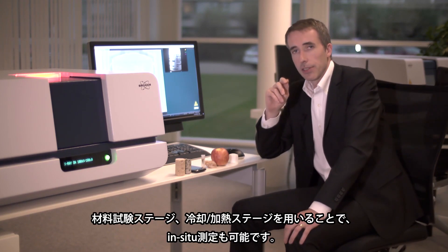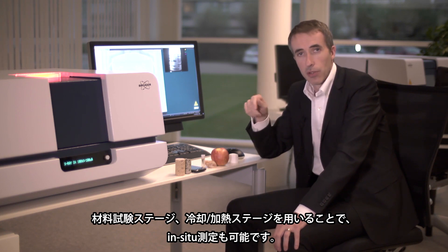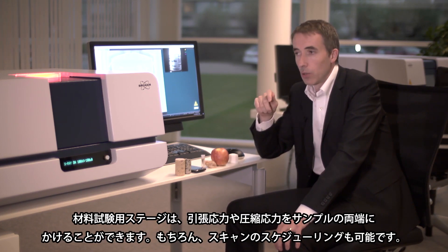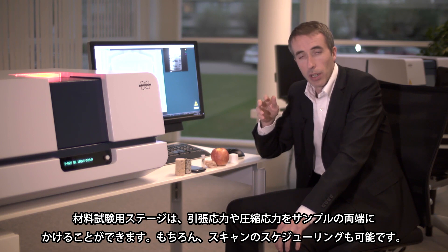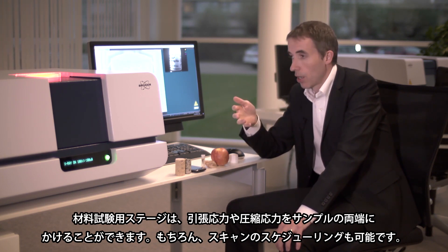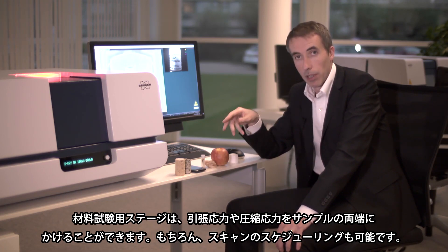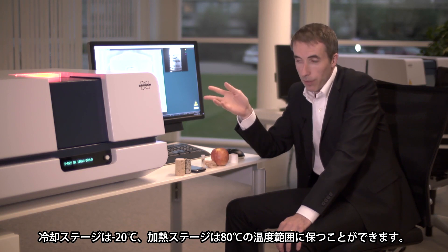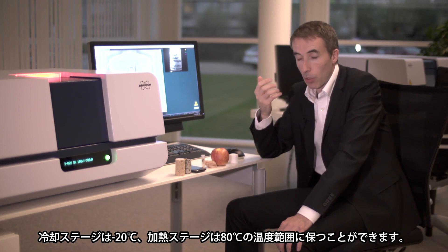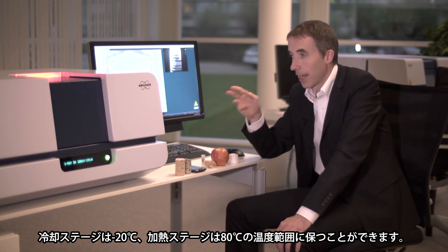Optional for this scanner is that it can also come with a range of additional stages. These stages can include mechanical properties like compression or tension, where you can place in the sample and at different loads or at different displacements you can scan repetitively. An alternative stage is a heating or cooling stage where the sample can be heated or cooled to the desired temperature and then scanned at that temperature.